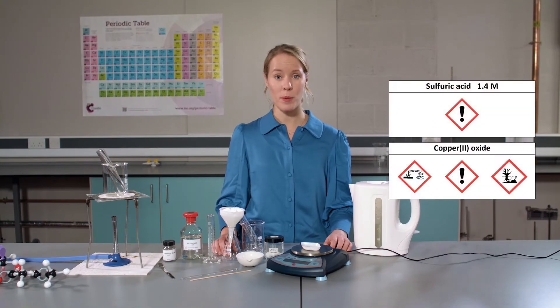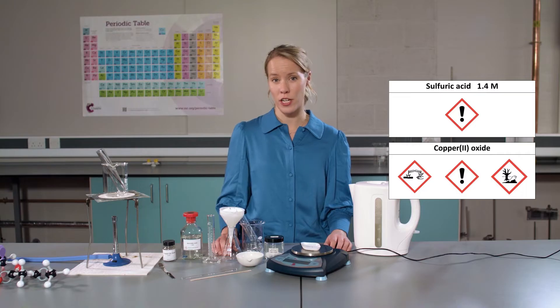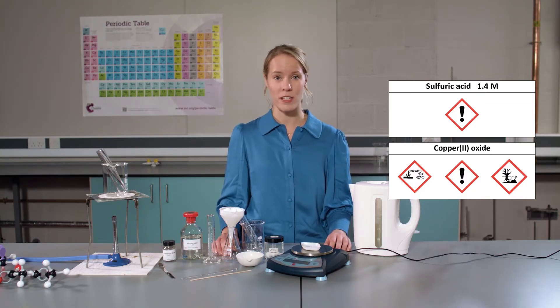Here I'm going to show you how to prepare some copper sulfate crystals. I'm going to point out where things could potentially go wrong and where we're going to be using a safer method than the standard one seen in the textbooks. But don't worry, we're going to follow all the same steps, just in a safer way.